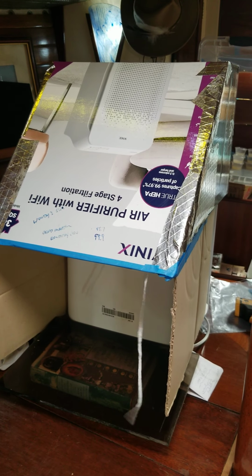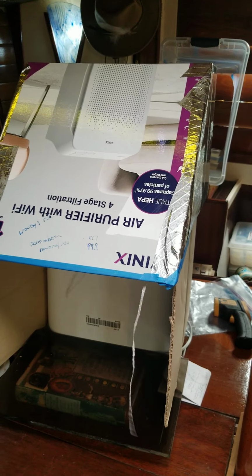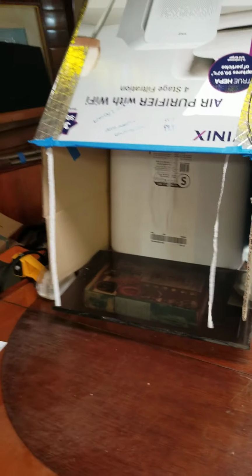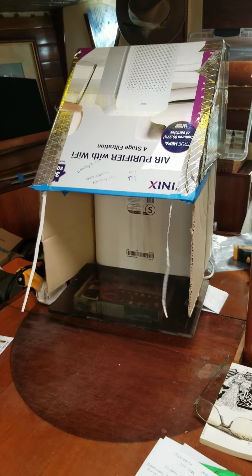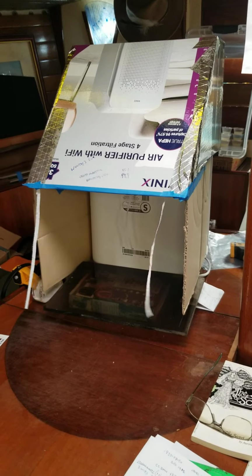You could set the filter below your workspace and put the box above the filter and then make a horizontal airflow. This is just the way I chose to set it up. And I elevate my workspace up above the table just with a little piece of plexiglass I had, and spray it all out with isopropyl alcohol and flip this on and let it run for 10 minutes, and in my opinion, you can't beat it. And it's only $130 and some duct tape, and there you go.